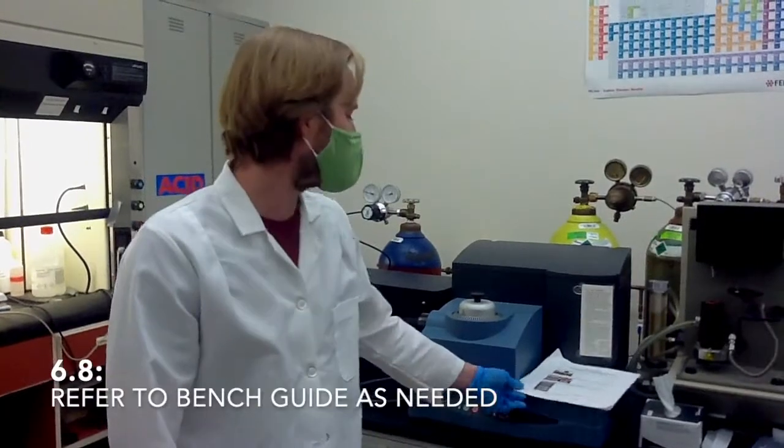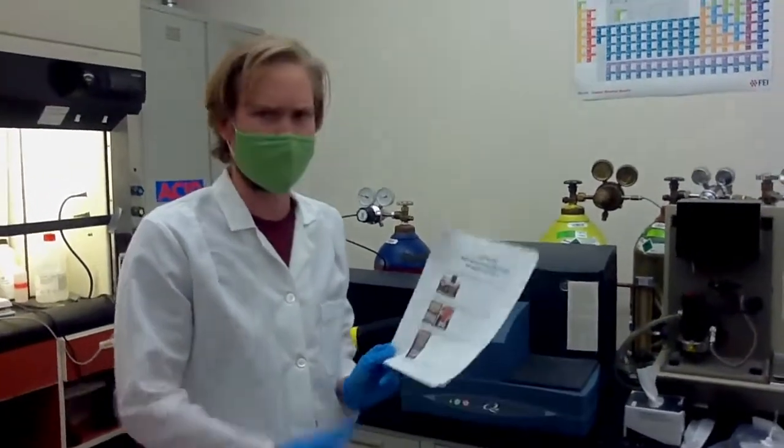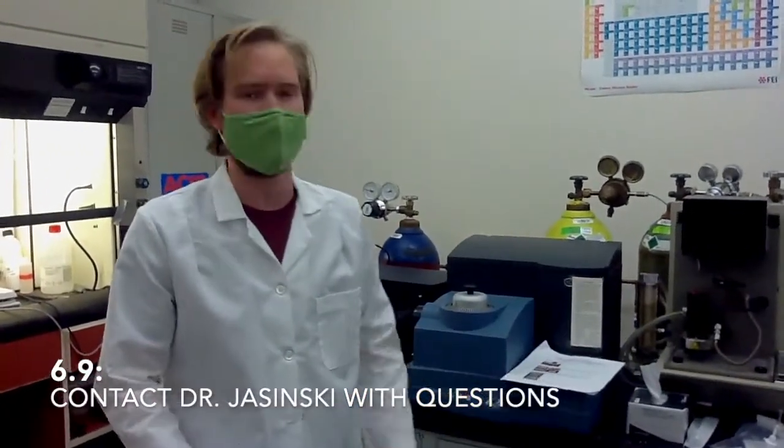And if you have any issues, there is a guide here on the bench, or you can send an email to Jacek Jasinski.